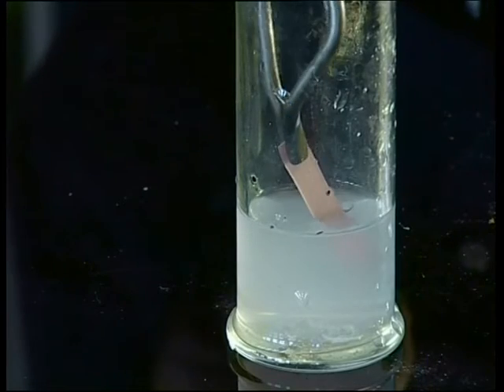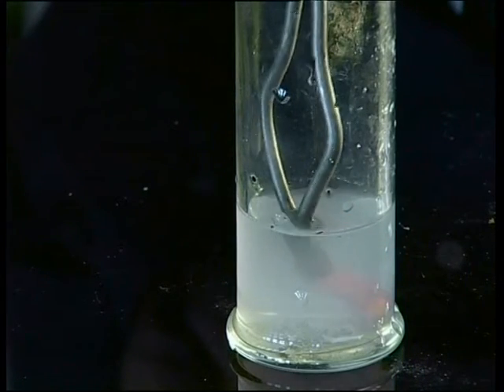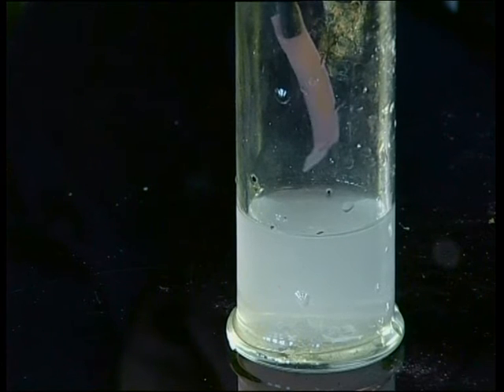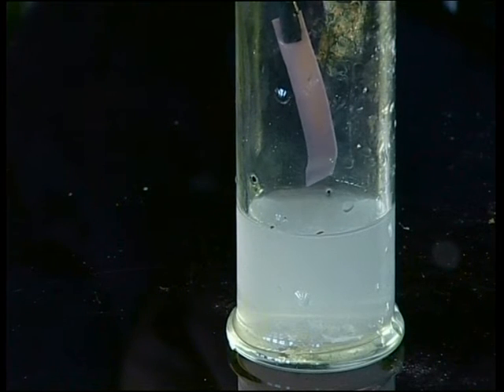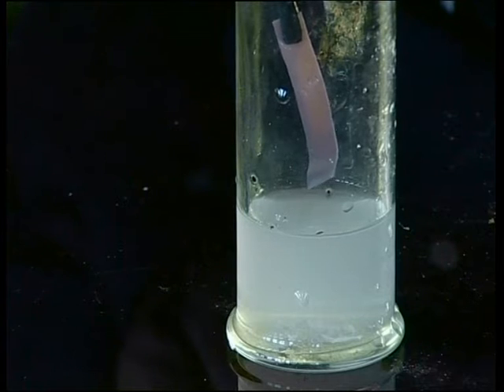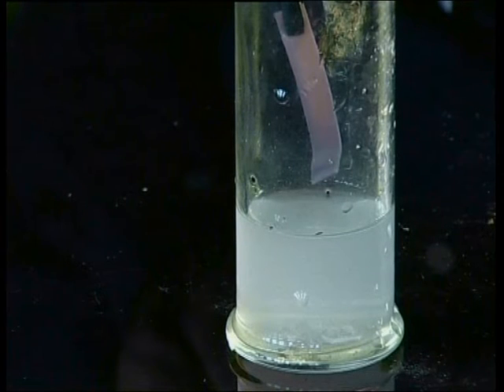We can test to see if the water has changed pH using red litmus paper. When a piece of red litmus paper is dipped into this solution, it turns blue in color. This shows that the solution is basic, and also that some of the magnesium oxide has reacted with the water to form a new substance.